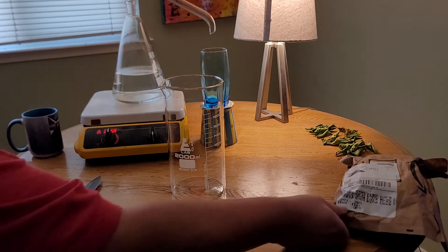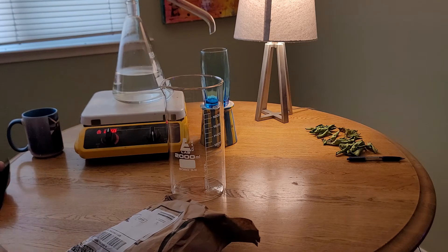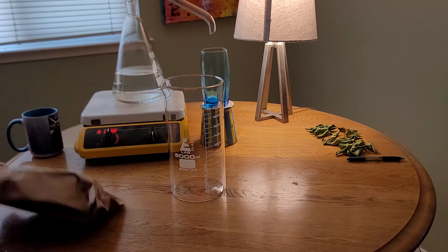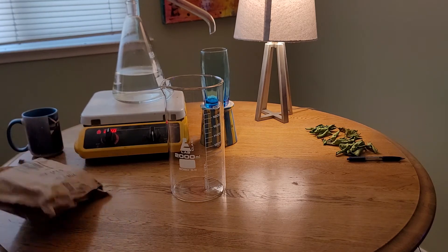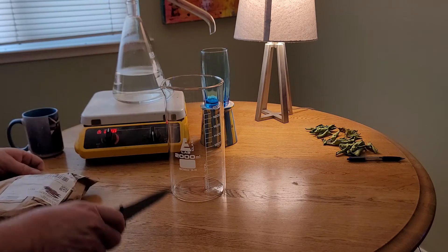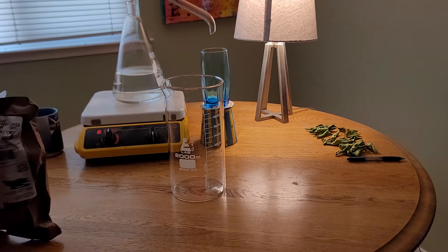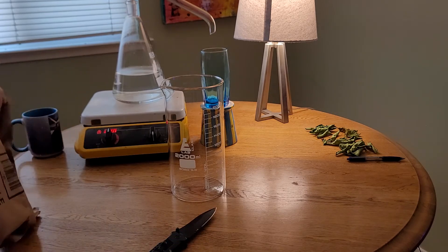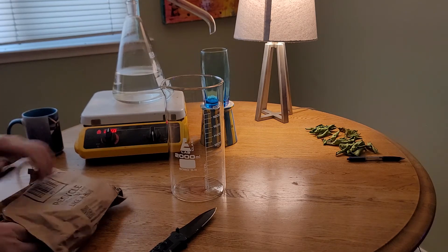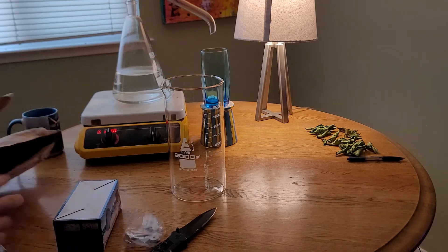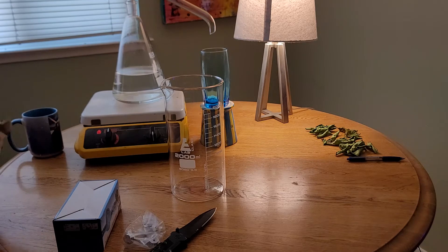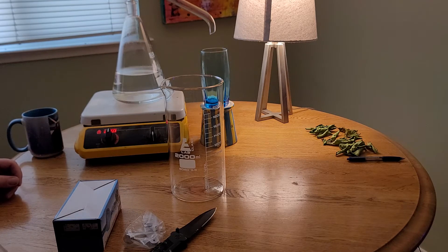I know some of my watchers have been asking me to do more videos with nitric acid, and that's what this beaker is for, as well as the rest of this stuff. I want to try some variations on the processes of dissolution.